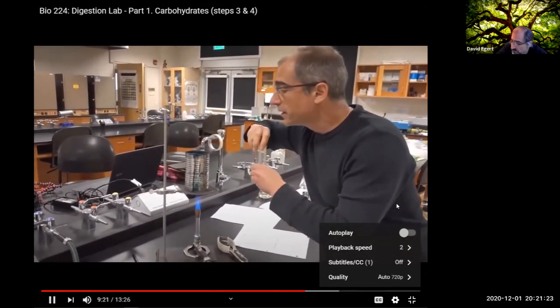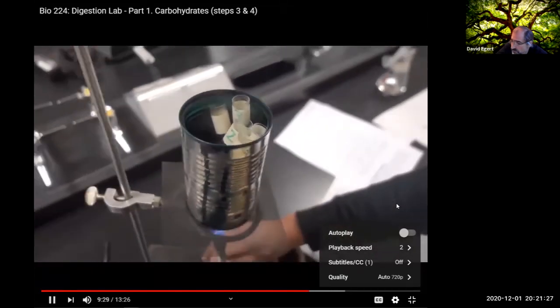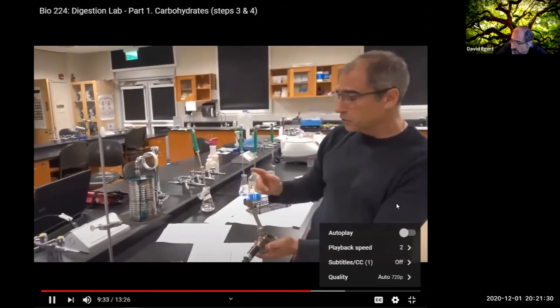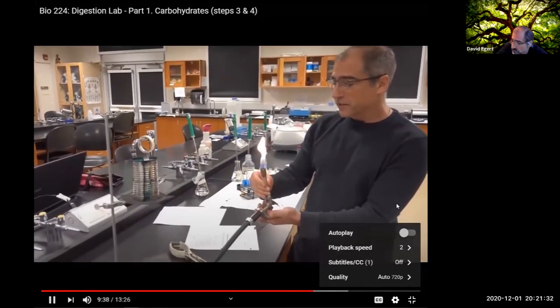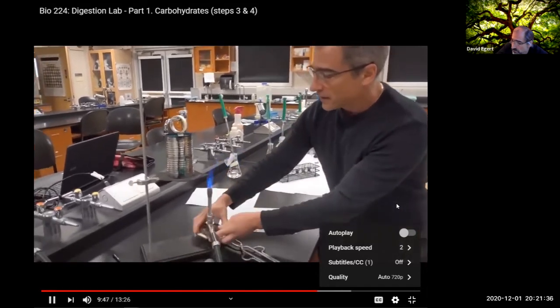We have this in boiling water here. When you're using a Bunsen burner, make sure you have a nice blue flame that's hot. If it's not adjusted, this is not hot. The water's not going to boil. So you want to make sure you have the blue cone of heat.